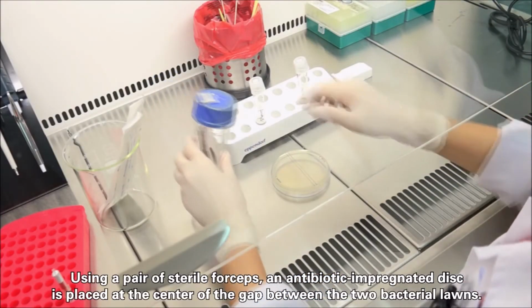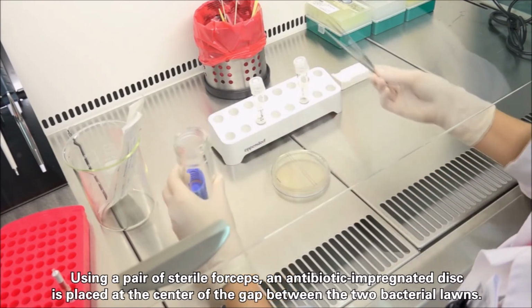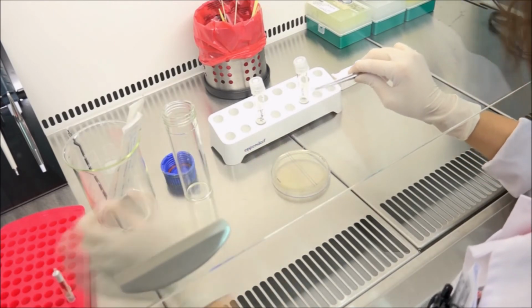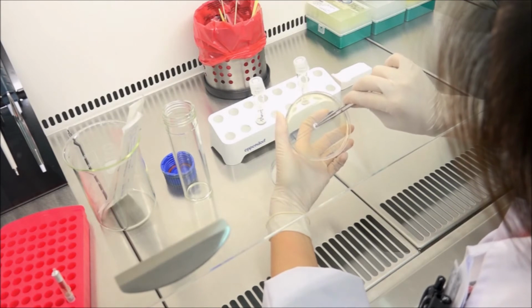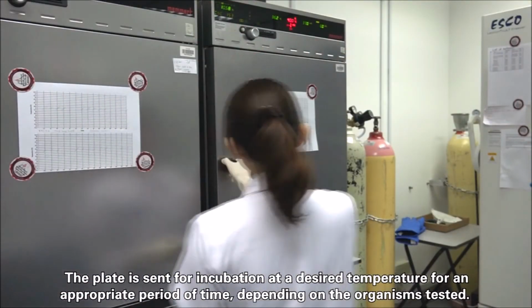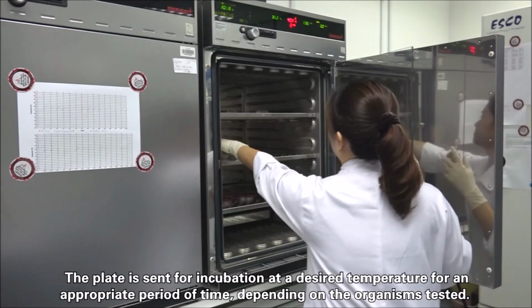Using a pair of sterile forceps, an antibiotic impregnated disc is placed at the center of the gap between the two bacterial lawns. The plate is sent for incubation at a desired temperature for an appropriate period of time, depending on the organisms tested.